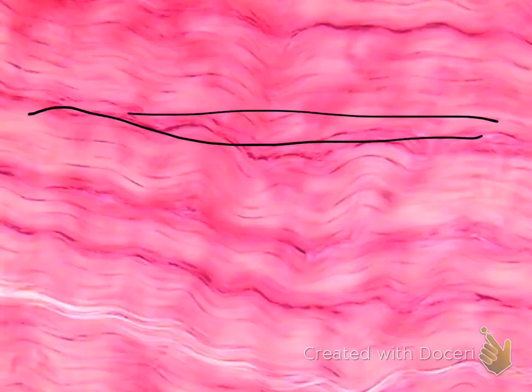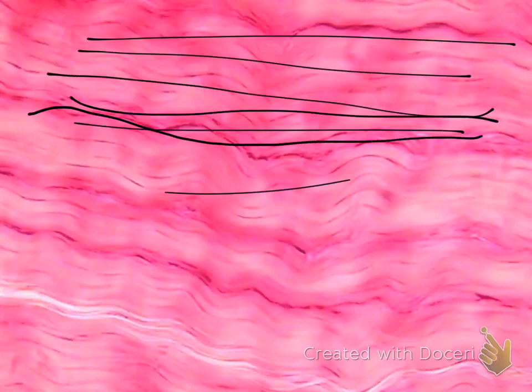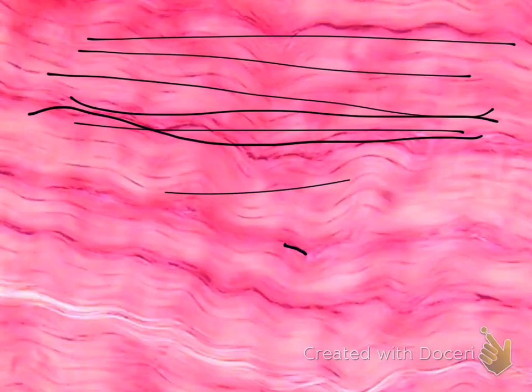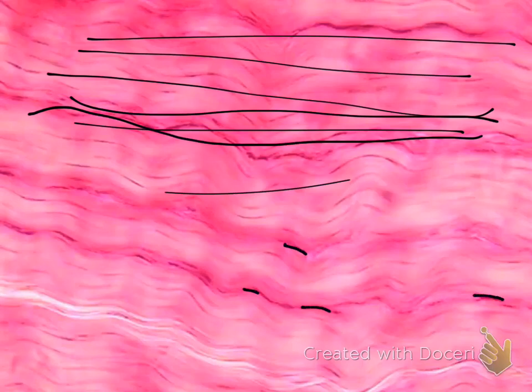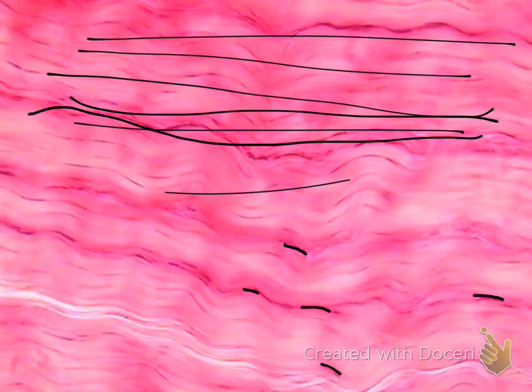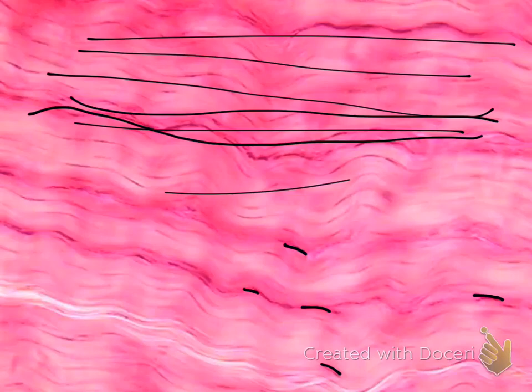The first thing you notice in this tissue is the absence of any kind of cells. All you see is rows and rows of collagen fibers, and then you can see tiny areas showing the nucleus of fibroblasts. Seeing collagen fibers with the nuclei of the fibroblasts tells you that you are looking at dense connective tissue.